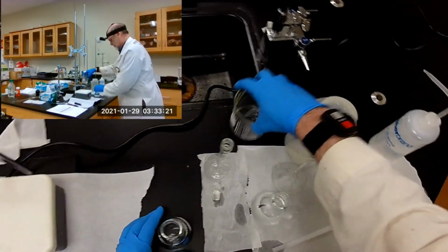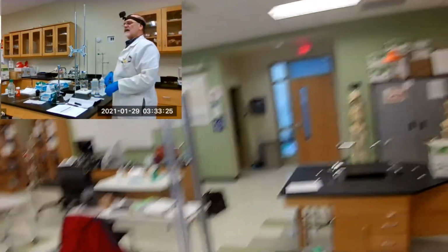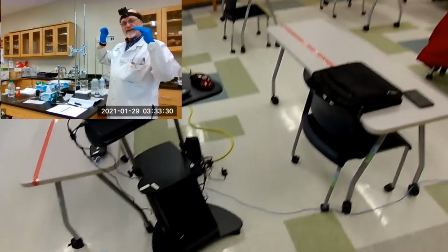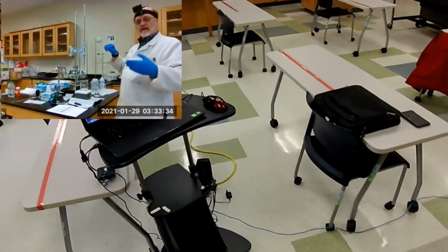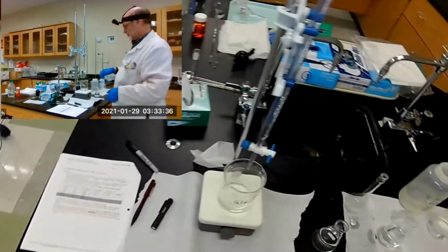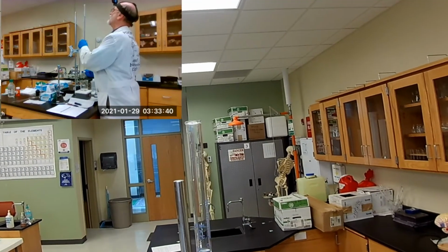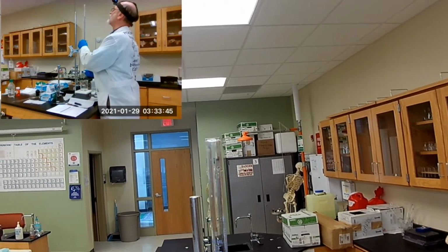And I'll tell you what. Let's set this, let me bring it down to 1 milliliter. Exactly on the 1 milliliter mark. That way, all I have to do is subtract 1 milliliter from the value I get. So let's bring it down to 1 mil. Oh, too far.